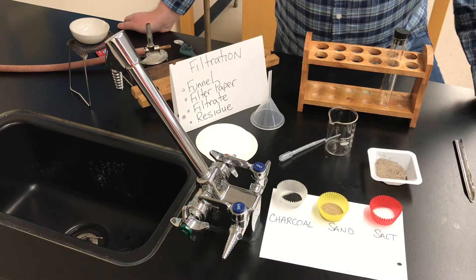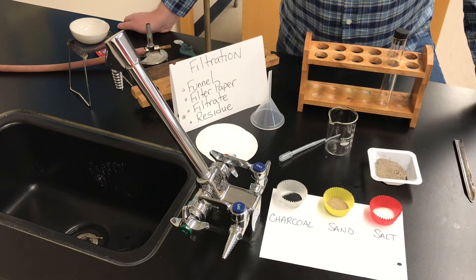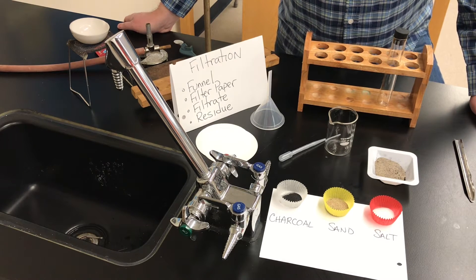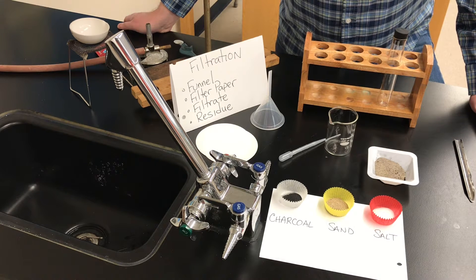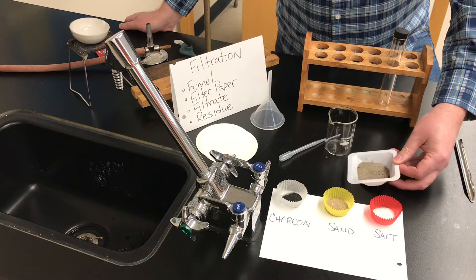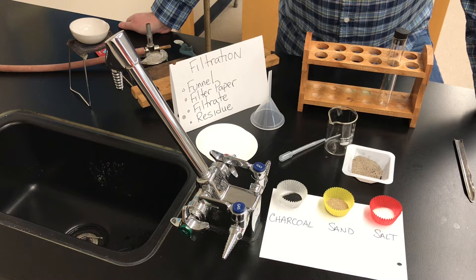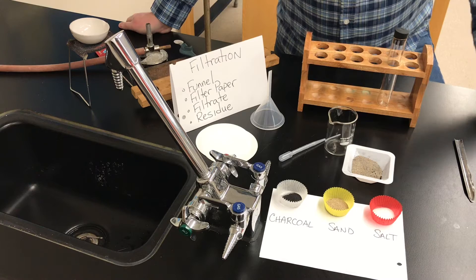The purpose of the experiment is to separate the three components of the mixture and obtain pure samples of each component. We're not trying to achieve 100% separation — we don't have to get all of the charcoal or all of the salt — but we'd like to end up with a pure sample of each substance. Pause the video and think about what you might do first if you were given this mixture and asked to separate them.